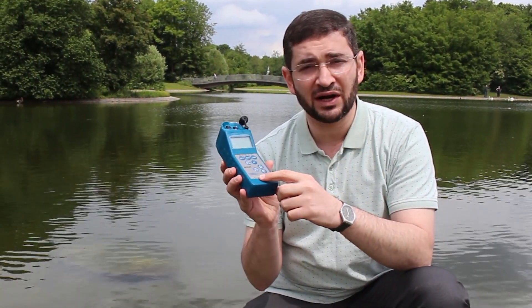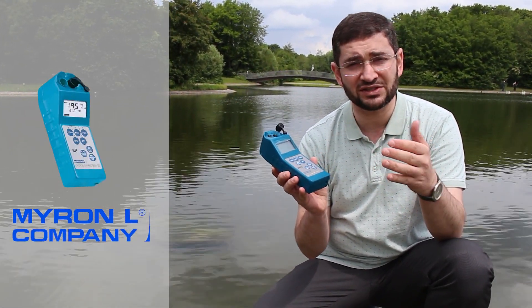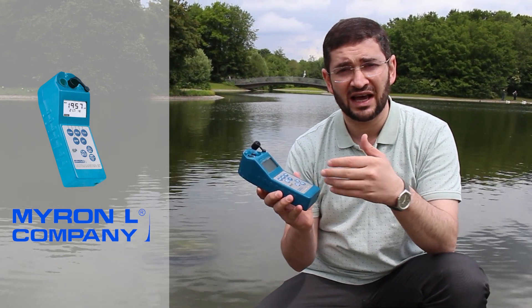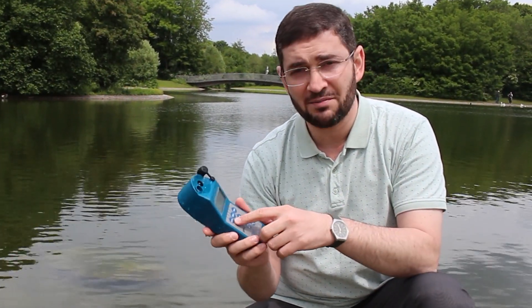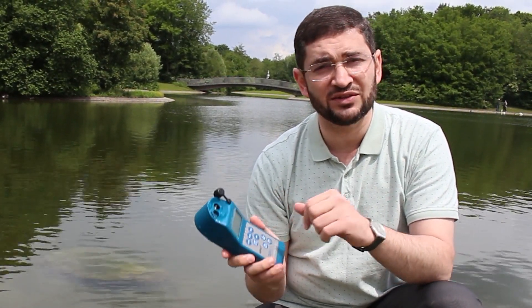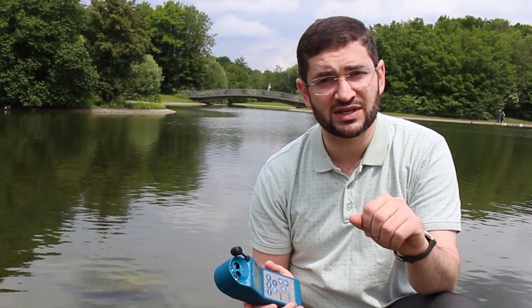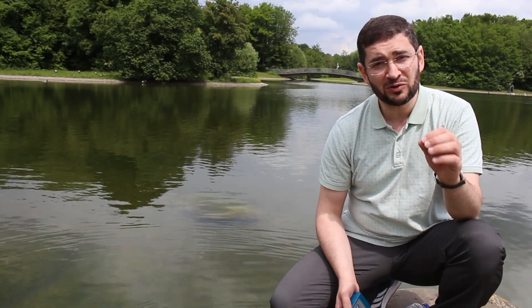This Myron 6P has fantastic functions and can be used in a wide range of applications as a handy tool. It can measure conductivity, TDS, resistivity, pH, and ORP — which stands for oxidation reduction potential.